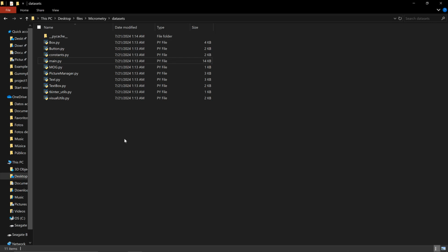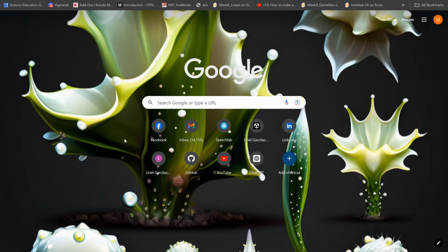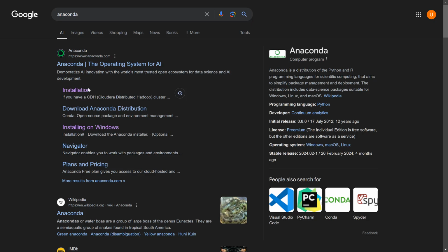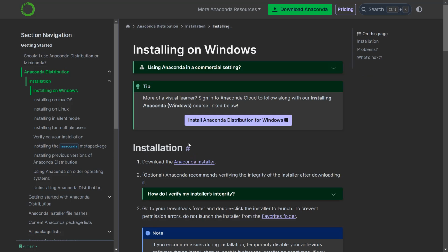The first thing that we need to make sure to have is Anaconda. If we go to the browser, we can search in here for Anaconda. And Anaconda is what is known as an environment manager. What it does is to control the installation of multiple versions of Python, and for that matter, other programming languages, so that they don't conflict between projects. Sometimes you need very specific versions of certain sublibraries that would conflict between each other when running different projects. Now, the installation is quite straightforward. You just download it and install it in your computer. But there is an important consideration.